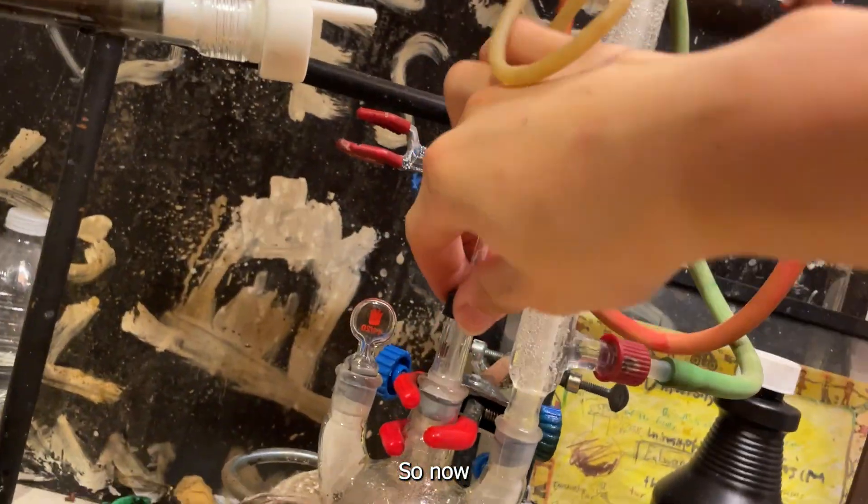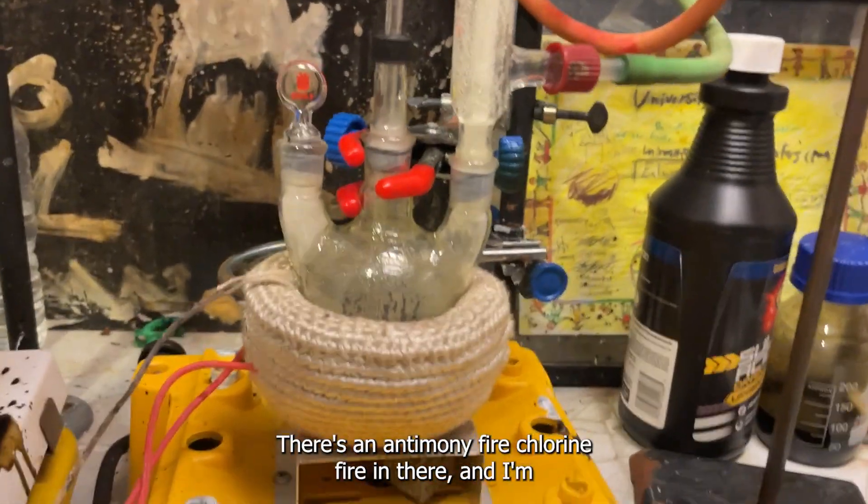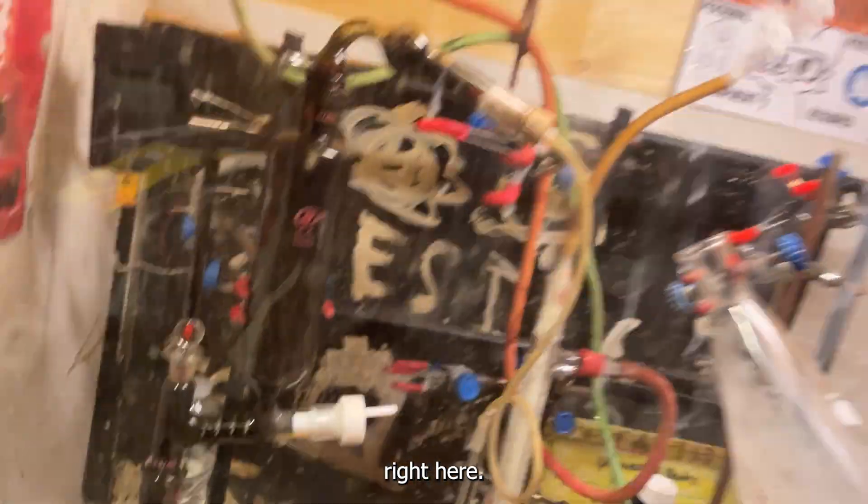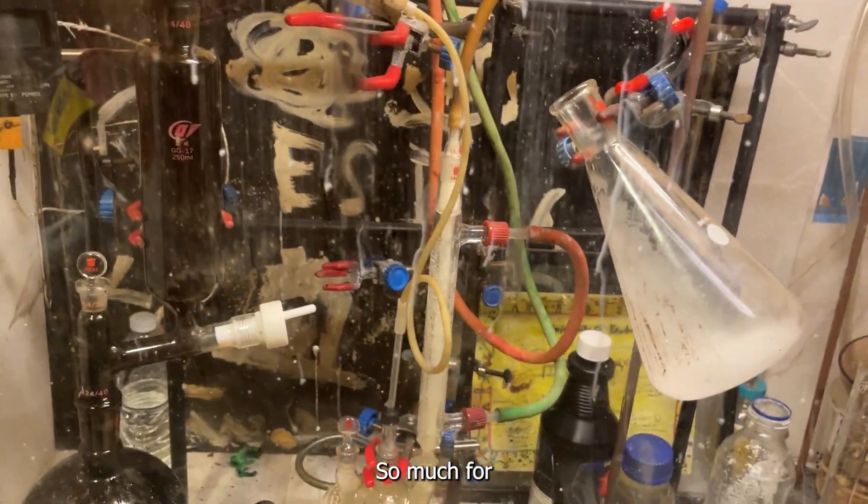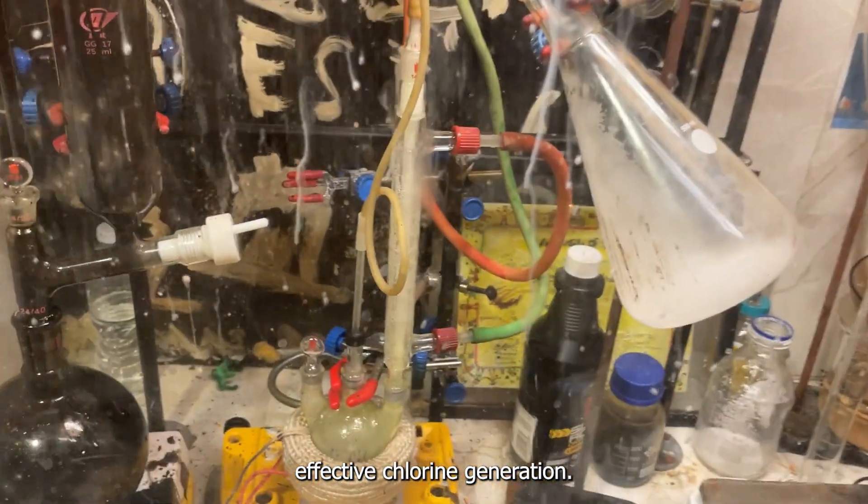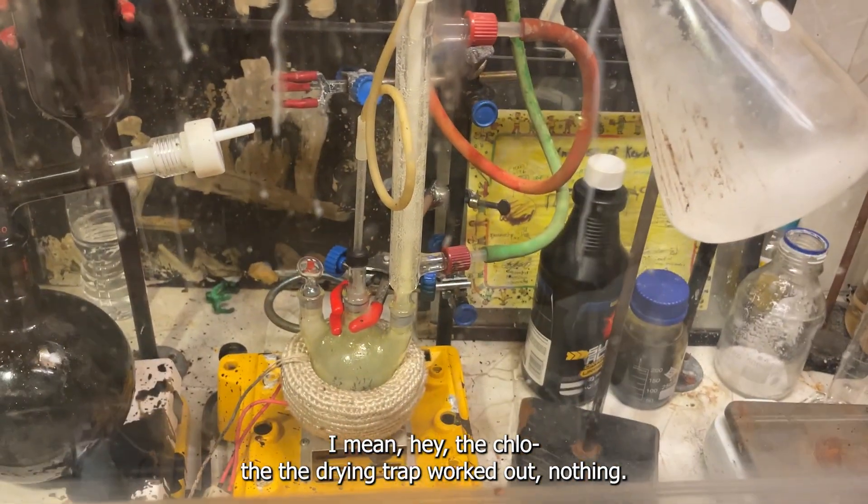Whoopsies. Oh no. What did I do? Oh yeah, there's an antimony fire. There's a chlorine fire in there. So much for effective chlorine generation. I mean, hey, the drying trap worked though. Nothing got in there yet.